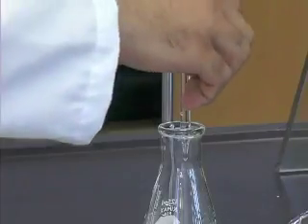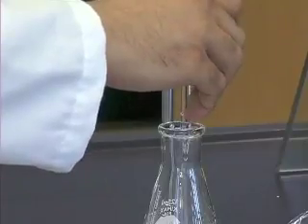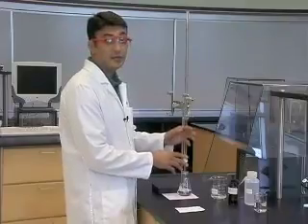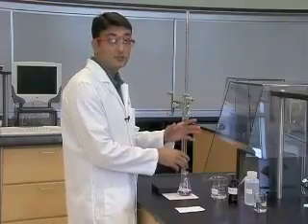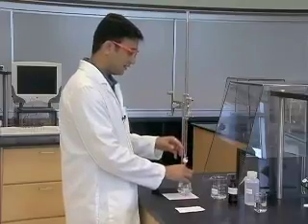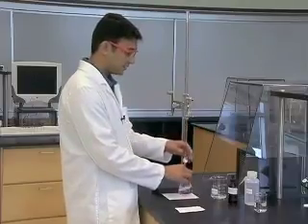Open the stopcock and allow the titrant to add to the flask. For an efficient titration, the titrant is added fairly quickly at the start and is slowed down to dropwise near the endpoint. You may notice that the faint pink color appears in the flask which then disappears upon agitation.